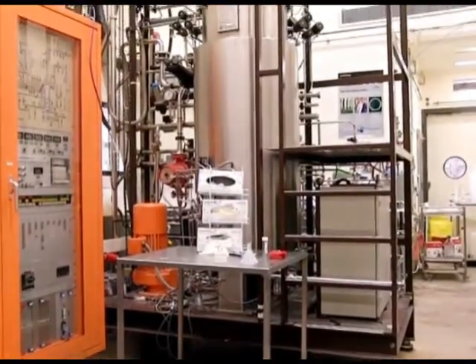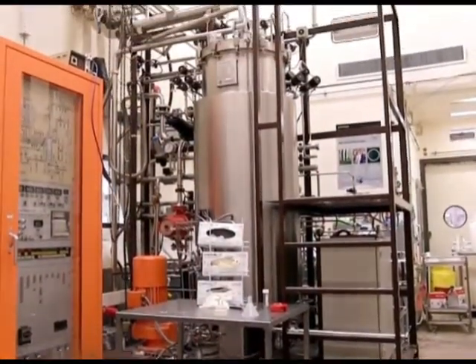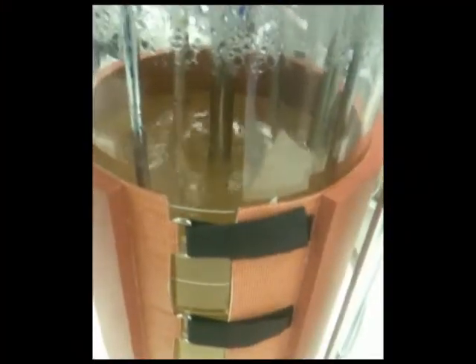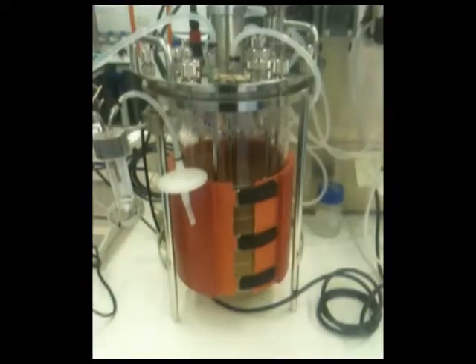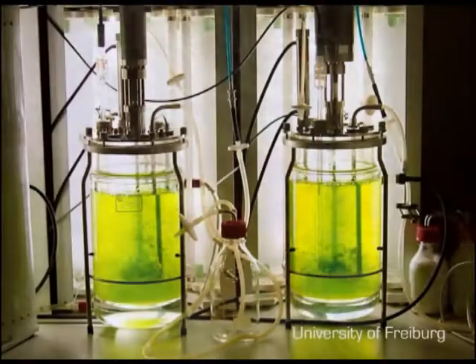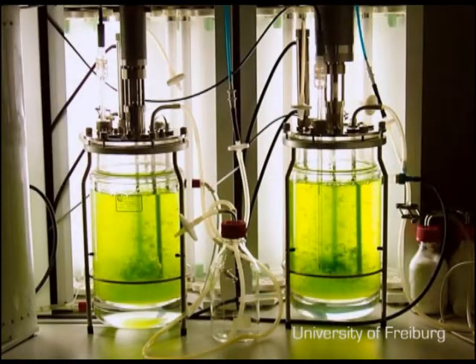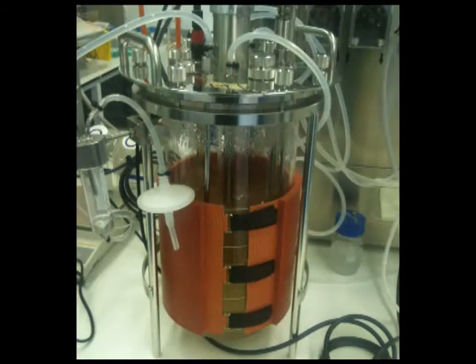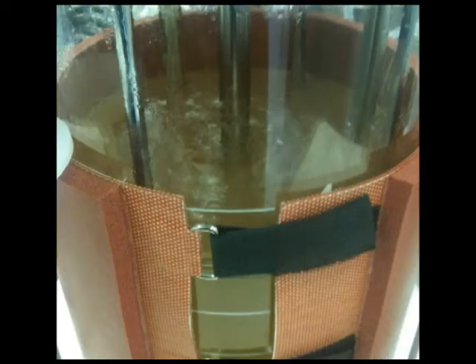Bioreactors are vessels where live organisms such as microbes and mammalian cells can be cultured and grown for a variety of uses, including drug manufacture. In order for these organisms to survive, specific conditions need to be met by controlling oxygen concentration, pH, temperature, and dissolved nutrients.